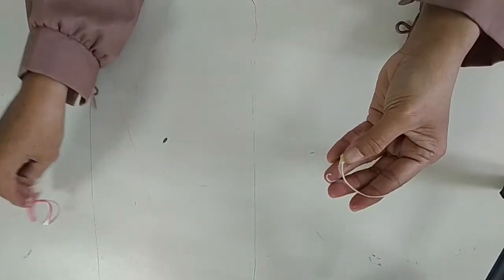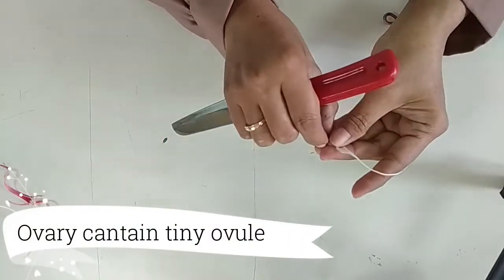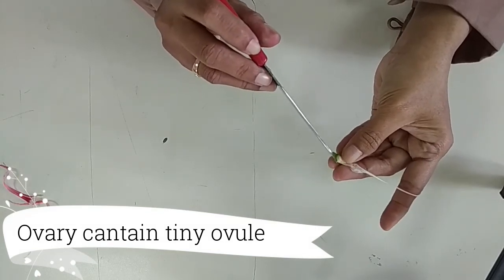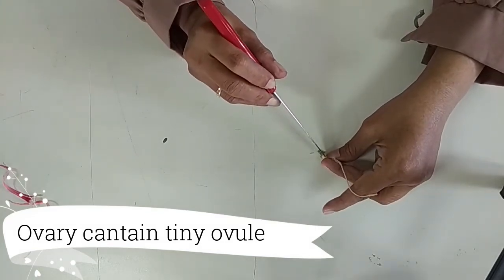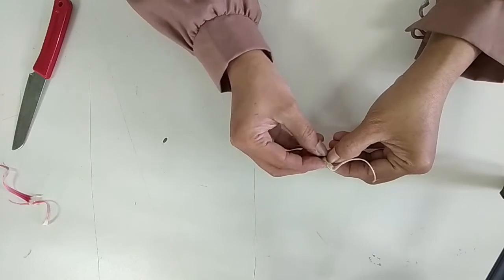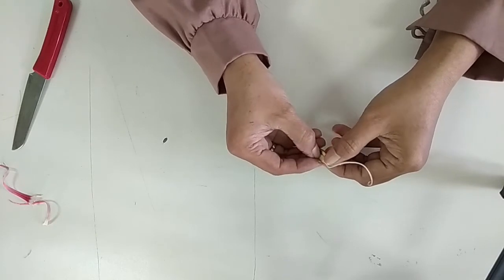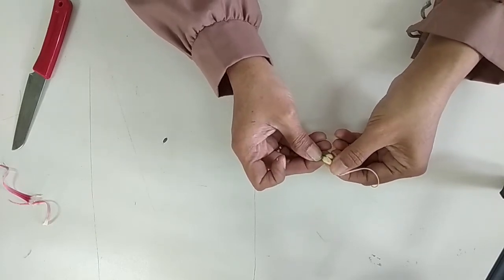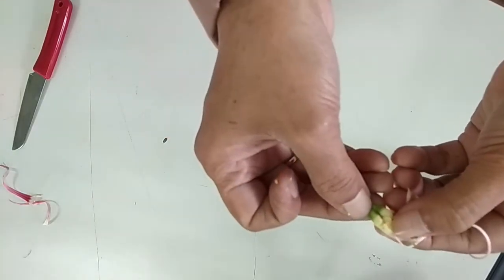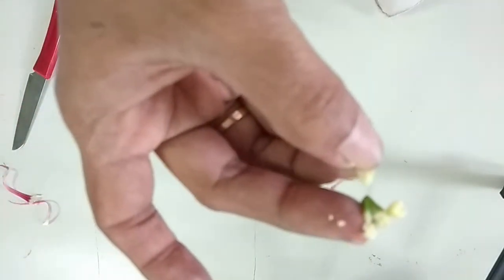Slice the ovary open with a scalpel. Inside, you'll find tiny ovules with an embryo sac and sometimes seeds. If you like, you can scrape them out carefully with the scalpel or knife. The ovules basically contain the egg or ovum of the flower. When the ovule is fertilized by pollen, it grows a plant embryo, which is contained in the seed until germination.